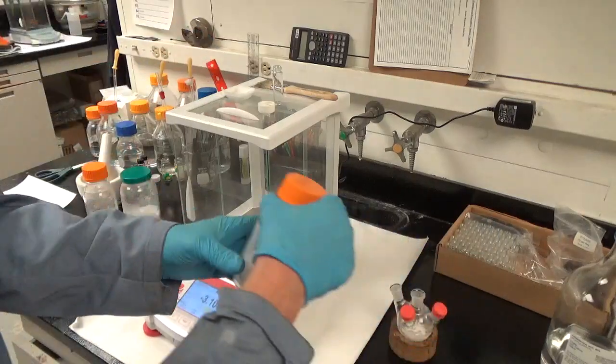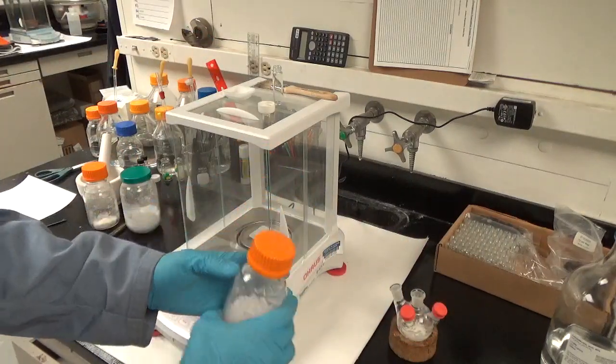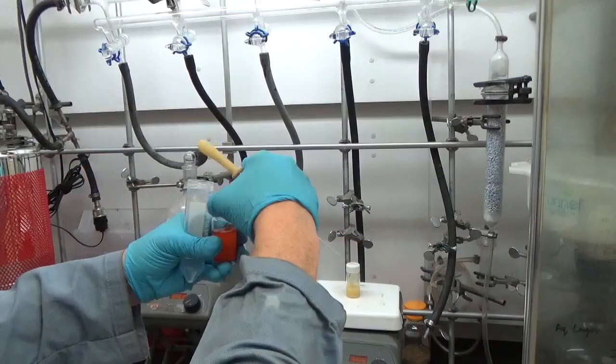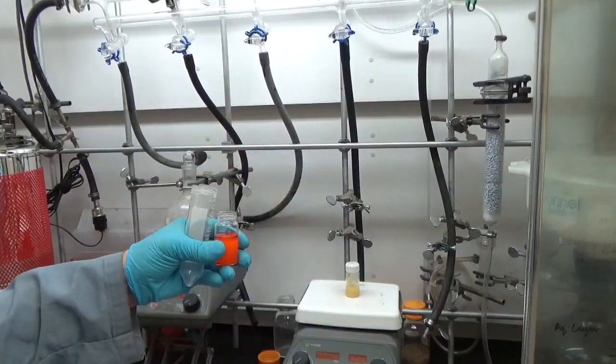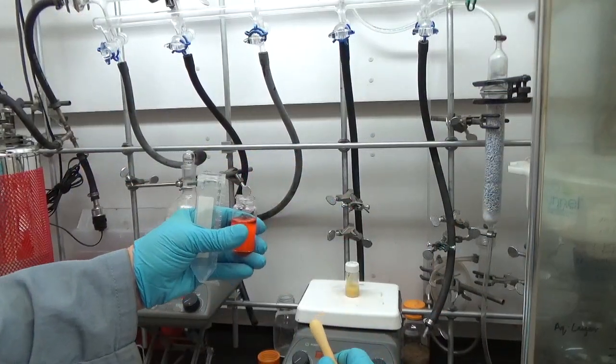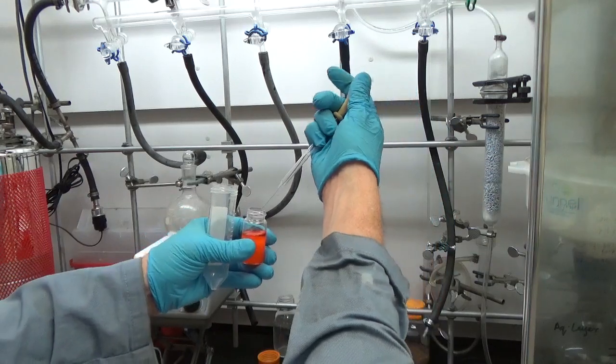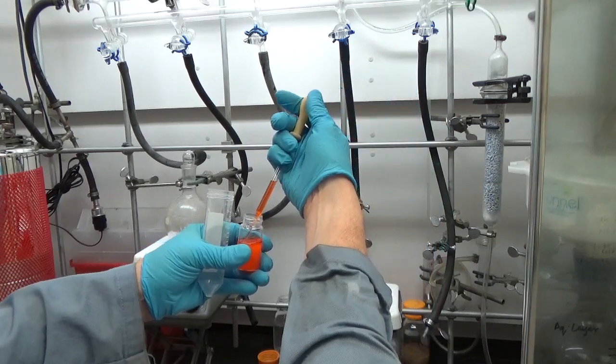Now this is where it gets funky. It's tempting to weigh out the cadmium for the cadmium shell, but we can't do that yet because we have to prep the core cadmium selenide quantum dots first.